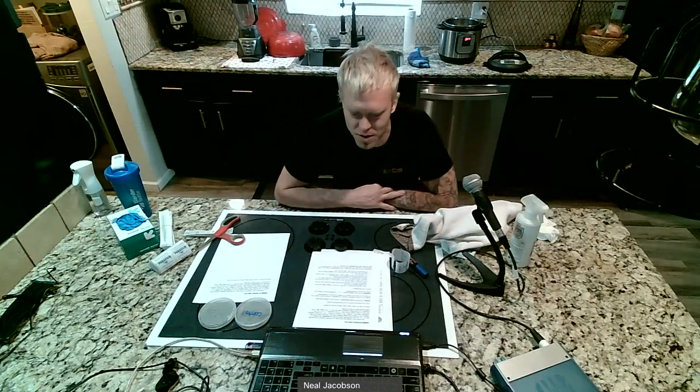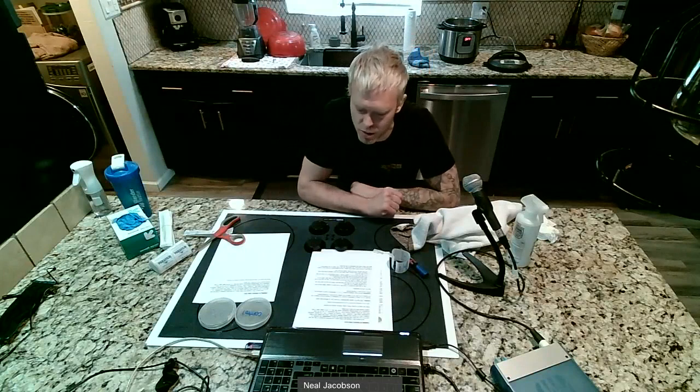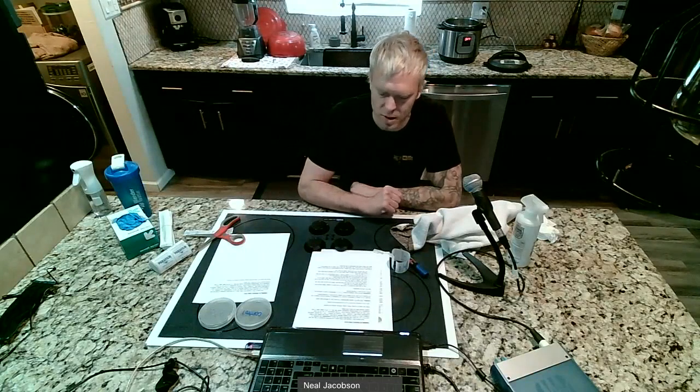Well, why? Because the bologna picks up all the dirt and gunk off the floor because it's wet. And so for this experiment, you're going to use the same techniques as the hand washing experiment, except this time we're going to use water to help transfer bacteria from our body to the plates. And then you can watch the YouTube video. Go ahead and click that link and watch that video and then come back and join me for this.